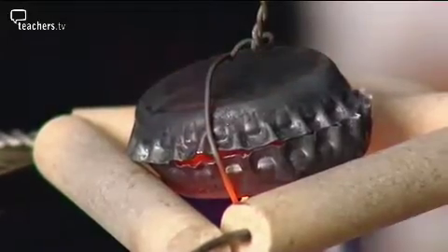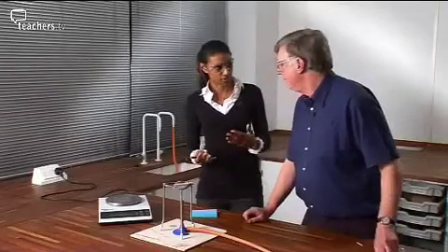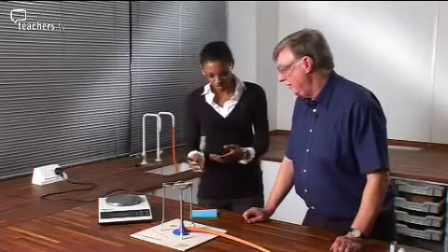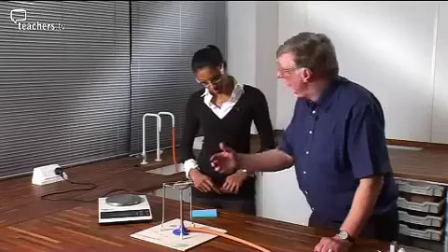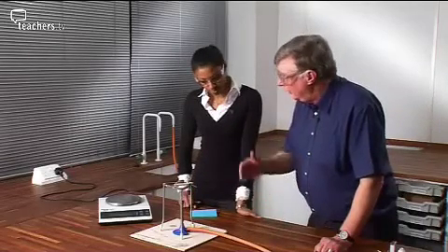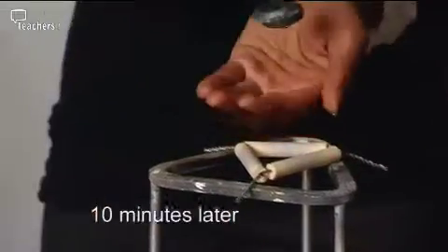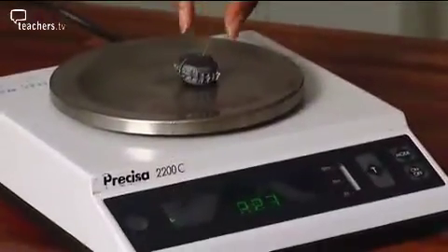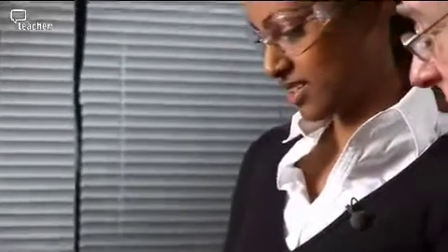So I guess the benefit of this setup is that you don't lose anything through the gaps in the bottle tops. That's right, and the students don't interfere with the apparatus. I think the students tend to interfere with it because they're trying to see what's happening inside. That's right. But you can see from the gaps that it's still burning. After about 10 minutes strong heating like this, we can allow it to cool and see what the increase in mass is. We get 4.93. So it has gone up. Yes, I think it's gone up just about the right amount as well. Excellent.